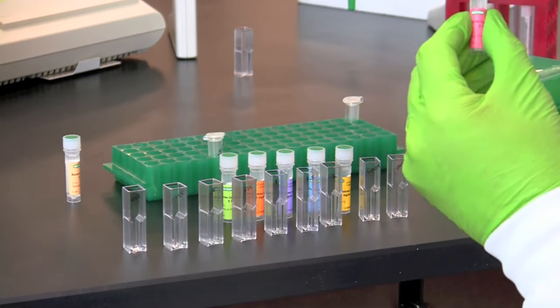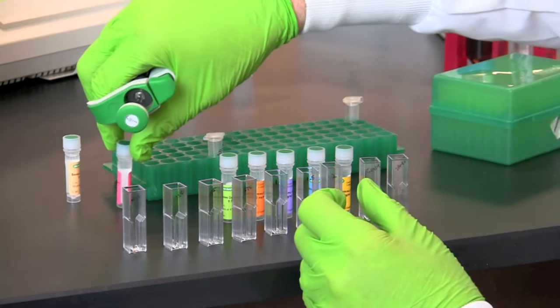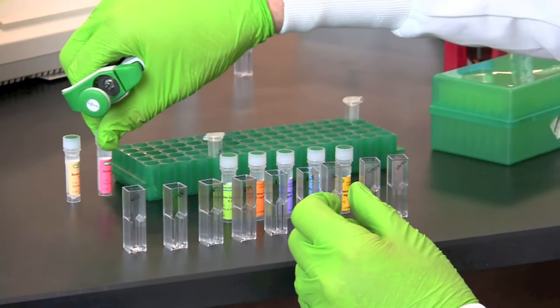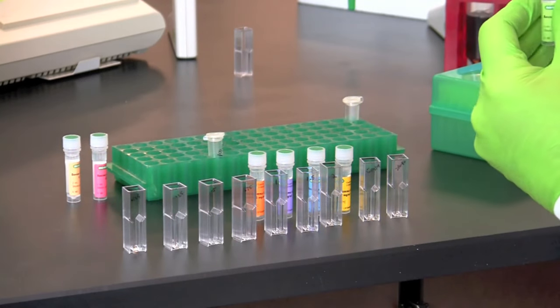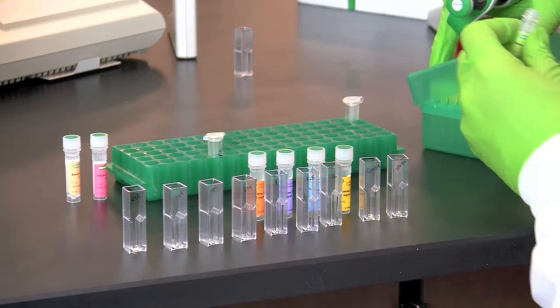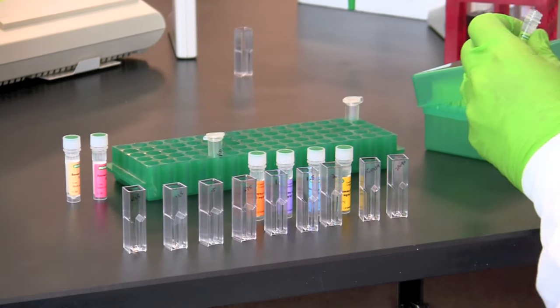Next add 20 microliters of each protein standard into the corresponding cuvette. Make certain you use a clean pipet tip for each sample.